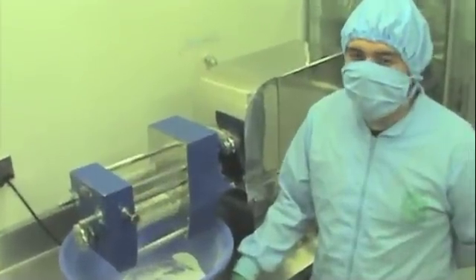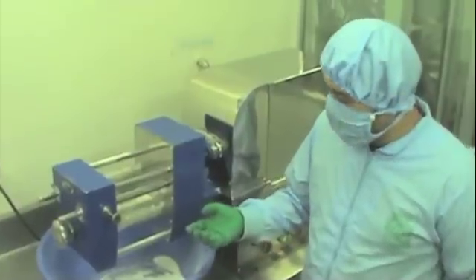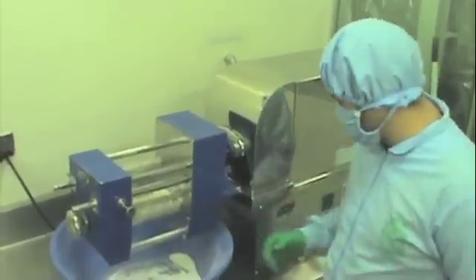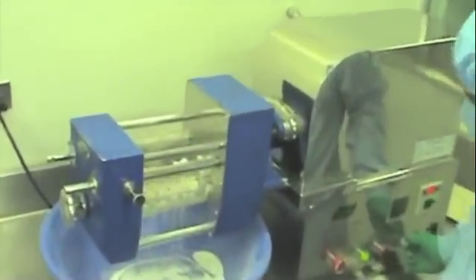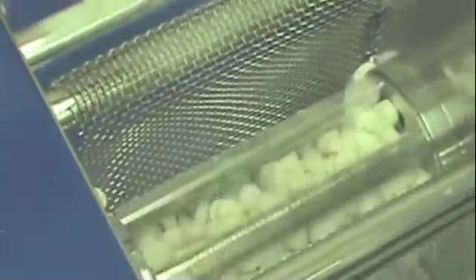Now we're in the fourth step. We already did the slugs, now we're going to do the dry granules. We'll pass it through a number 8 mesh so we can have the granular form of our formulation. As you can see in the final step, you can see the final granular form of our formulation.